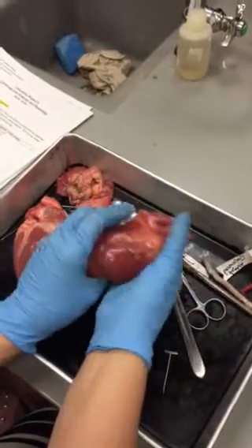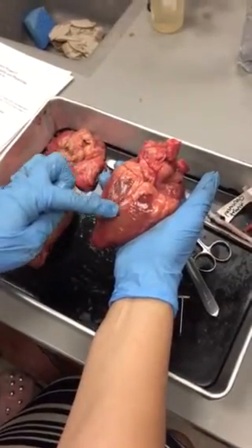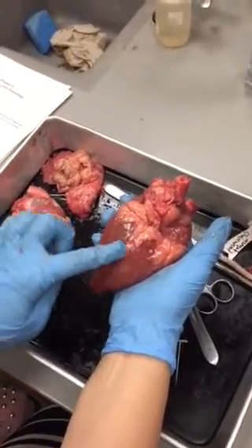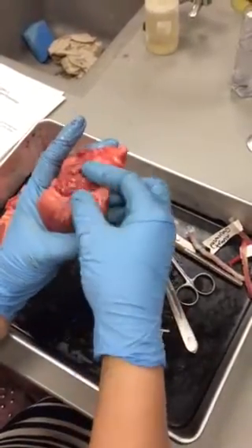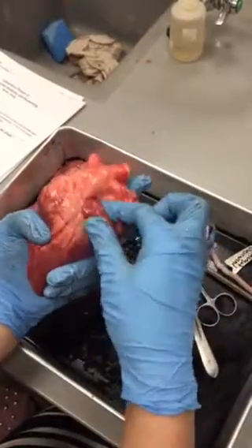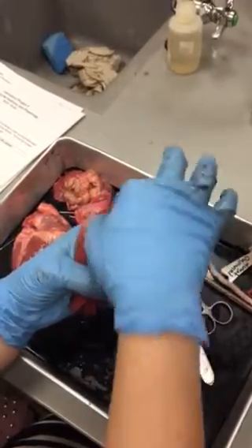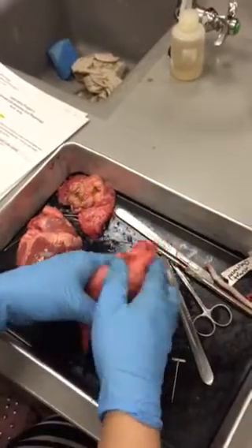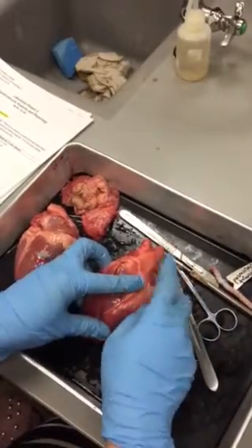That means that if you flip it around, you should have another line that separates the ventricles, and this is going to be your posterior interventricular sulcus. Okay, so this line. You also have two structures that kind of look like chewed bubble gum or like ear flaps here. And these are going to be your right and left auricles. Okay, so remember left side, left auricle. Right side, right auricle. Okay, you should be able to tell on a dissection if I have it laying down, you should be able to tell me which one is left and which one is right.